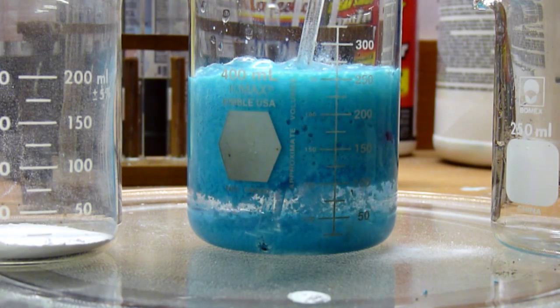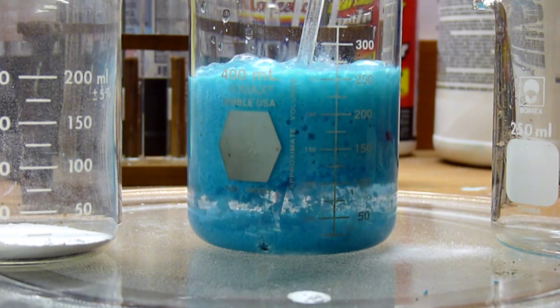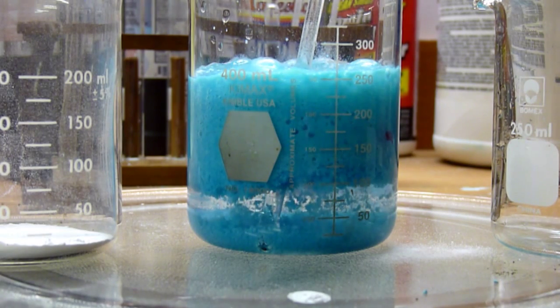A much easier way of making copper 2 carbonate. So, if you're going to make copper 2 carbonate, I would suggest using this method, as opposed to the other foaming method. Because it tends to make a mess.